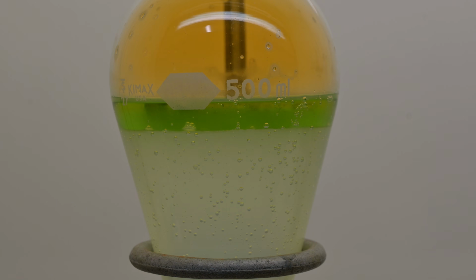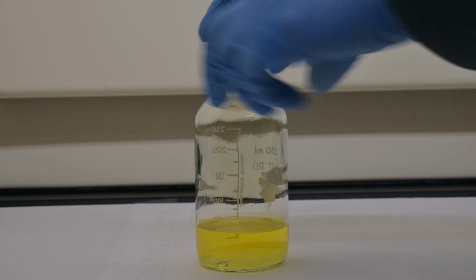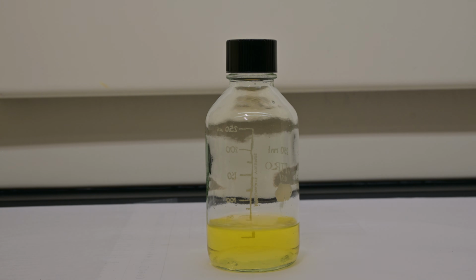These differences can easily be chalked up to minor variations in temperature control, mixing efficiency, and different side reactions occurring, or even the fact that my nitrite was a bit old. Next, I added 4 grams of anhydrous sodium sulfate to soak up any water that might be present. This is a crucial step because even trace water can mess up further reactions or shorten storage life of the chemical.